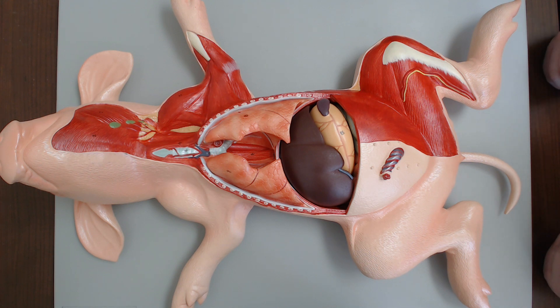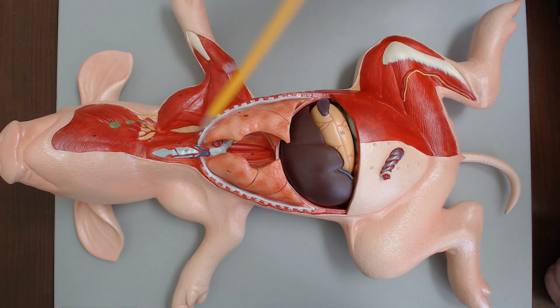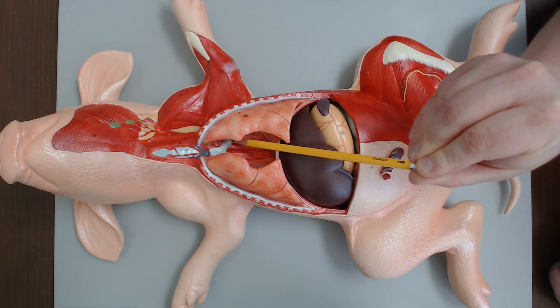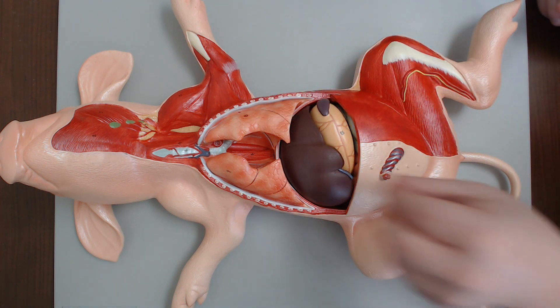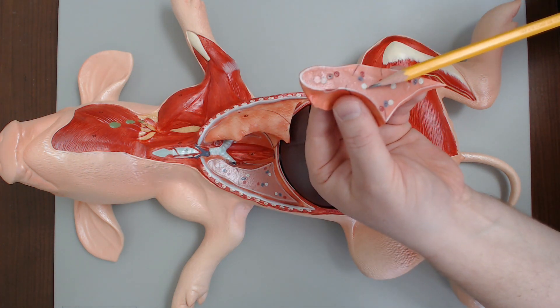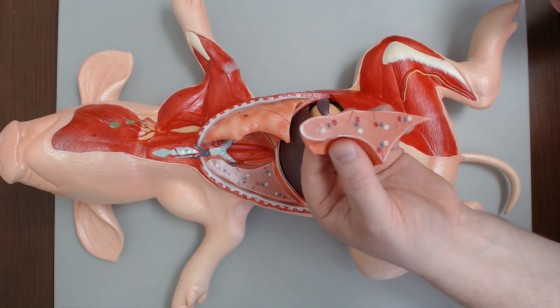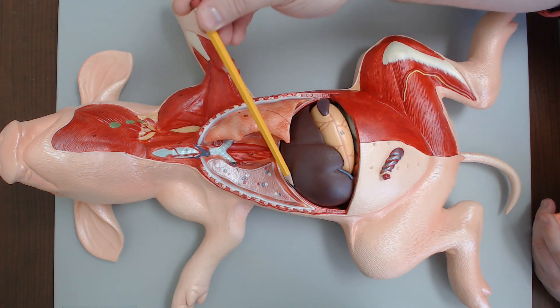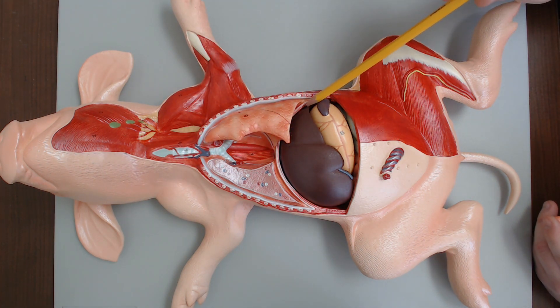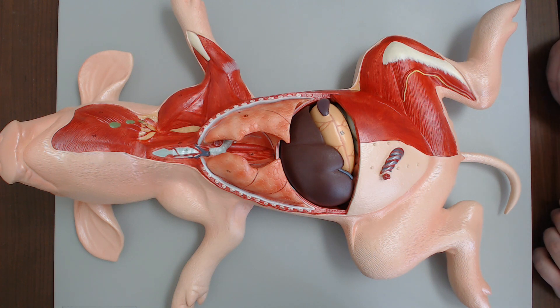Clean up your dissection and put your pig away. This is a model of the dissection that we just did. We can see a piece of the trachea along with this upper region — the larynx and the thyroid cartilage. You can see the trachea split into the primary bronchi, which then enter into the lung. We can see the two lungs. If we were to open up a lung, we can see these little structures here, which are going to be branches of the secondary and tertiary bronchi — the conducting zone that feeds into the lung. This structure along the top of the liver and the bottom of the lung is the diaphragm. I hope that helped. Thank you very much.